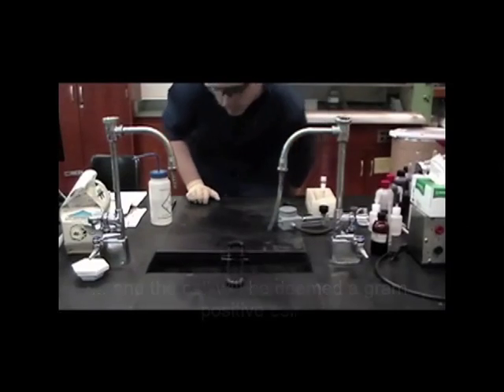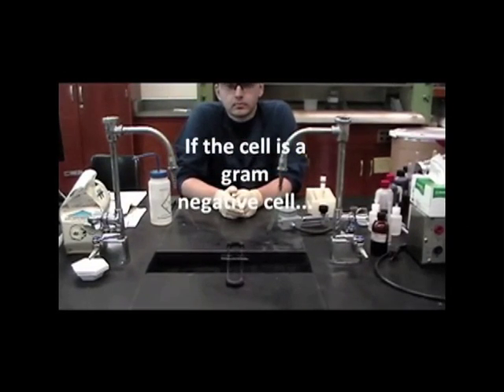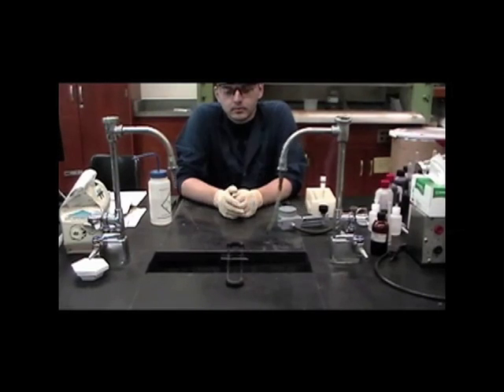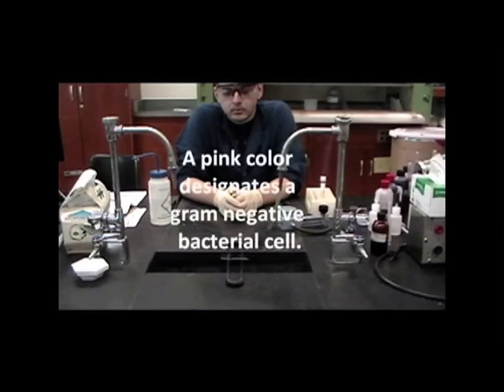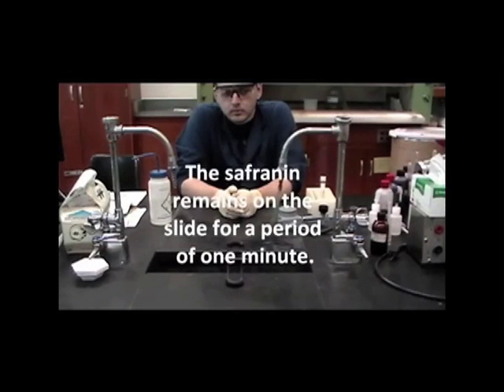If the cell is a gram-negative cell, the crystal violet should theoretically have been removed by addition of the 95% ethanol, permitting the orange safranin counterstain to then stain the bacterial cell, producing a pink color. A pink color designates a gram-negative bacterial cell. The safranin remains on the slide for a period of 1 minute.